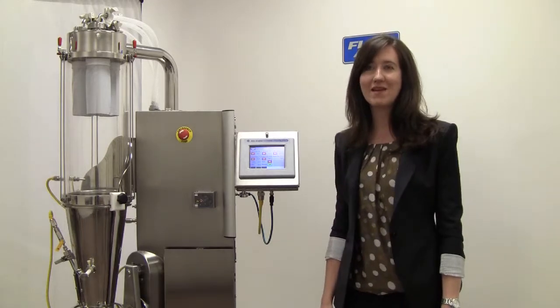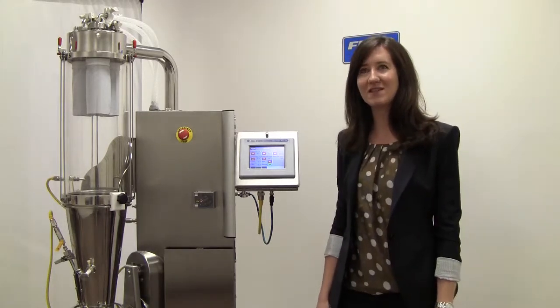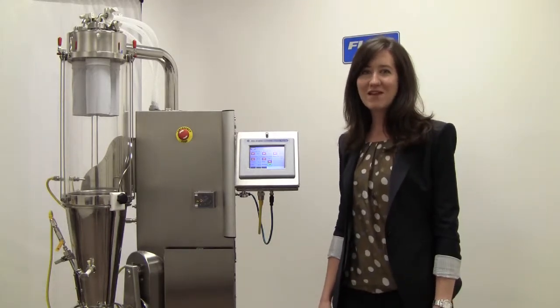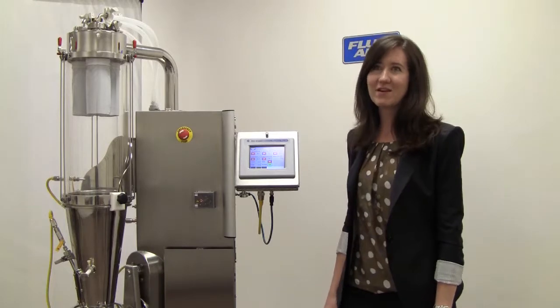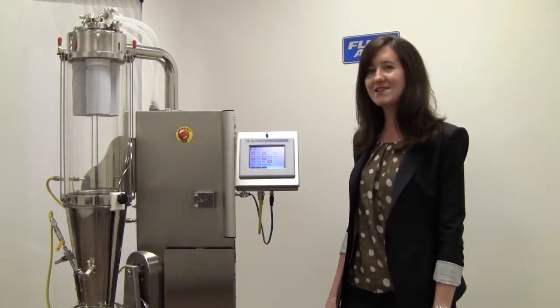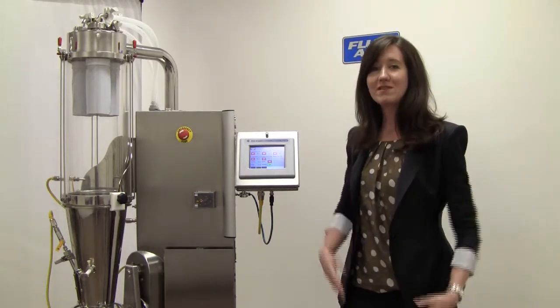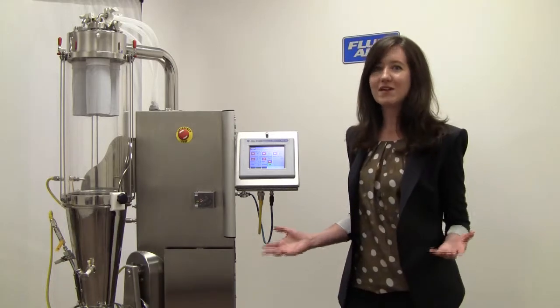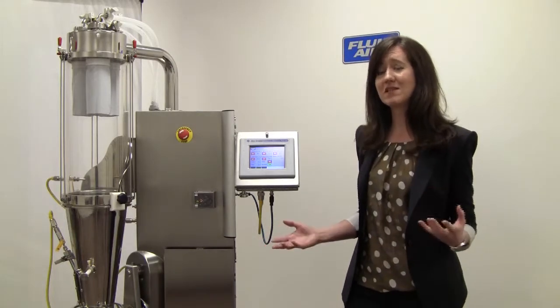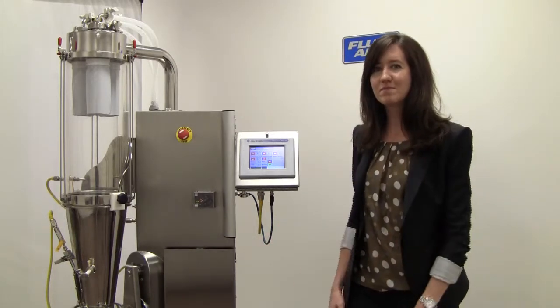It can be operated manually or with optional phase or recipe control. Using manual control, the operator changes the equipment states and operating set points. Using that mode, the operator has full control over the system and is responsible for how the process proceeds.